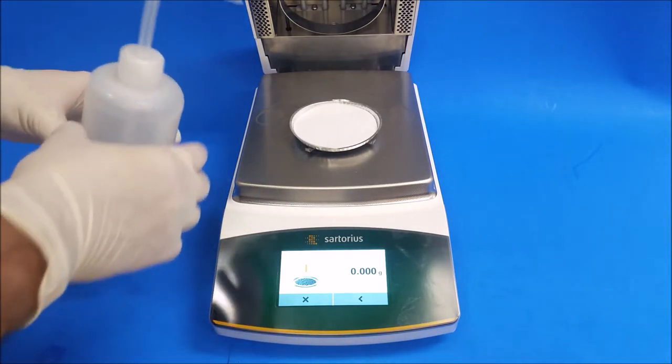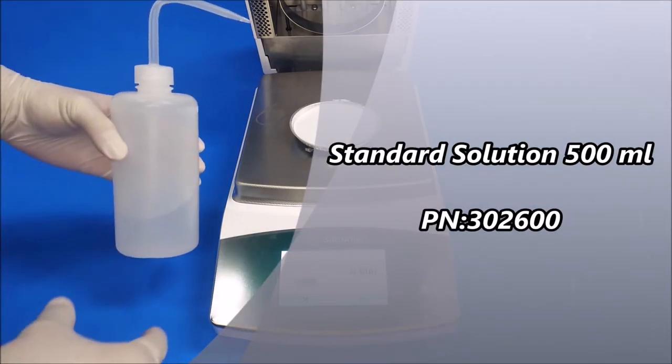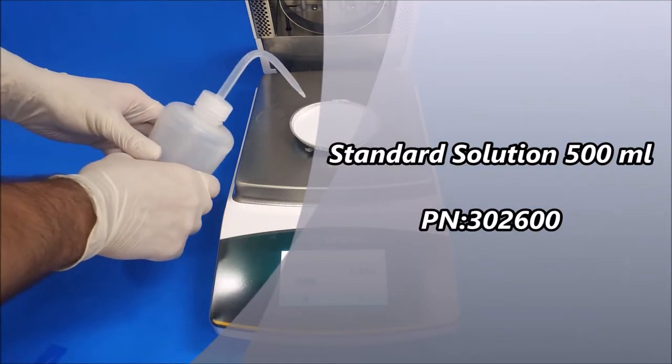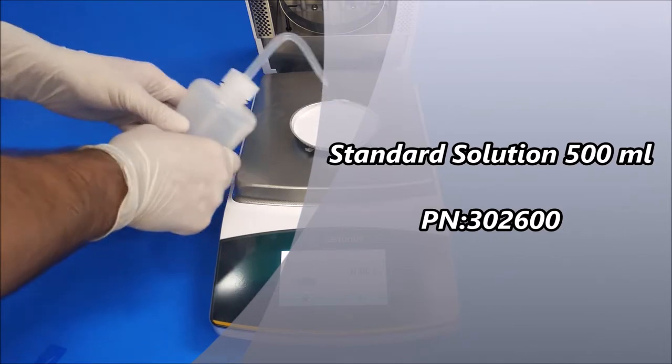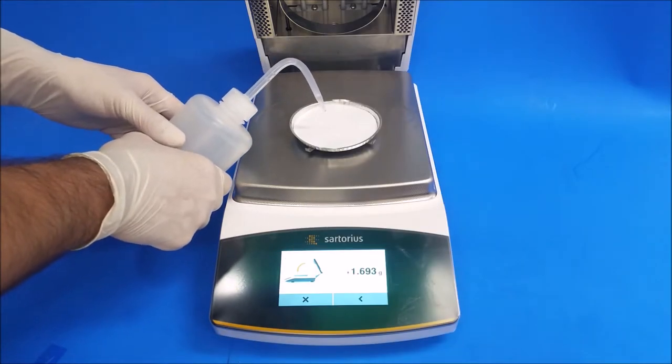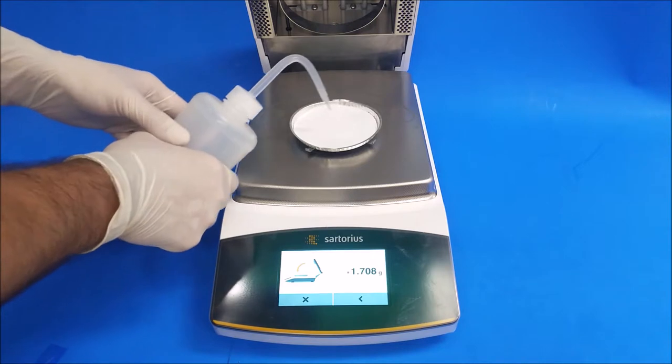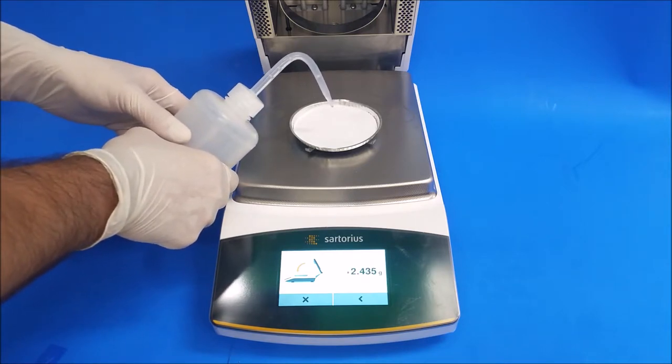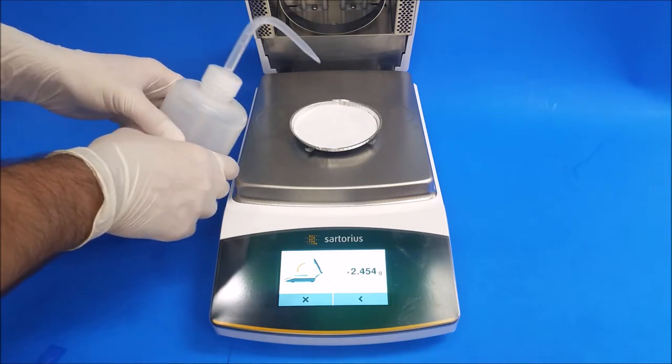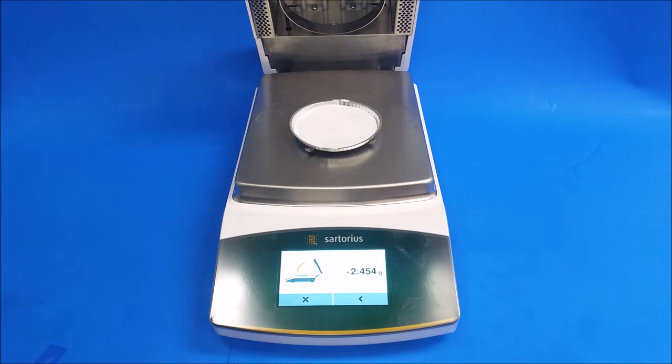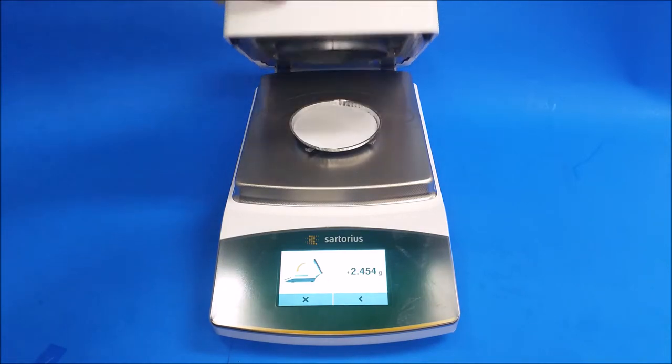I've put about 2.5 of standard solution. Now close the hood.